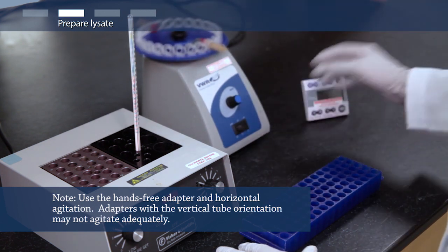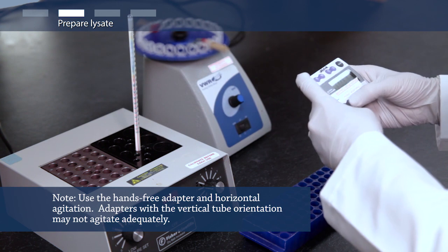Homogenize the sample by bead beating for 10 minutes. Adjust the vortex mixer speed to maximum.